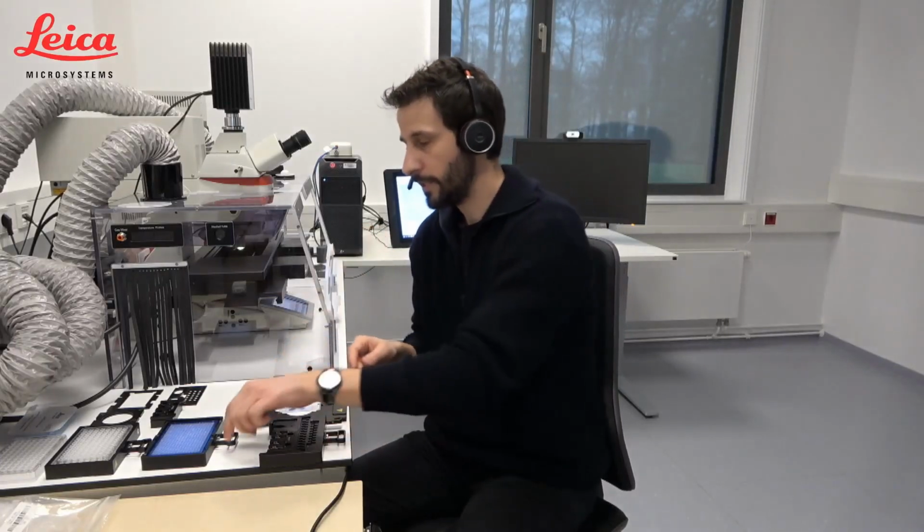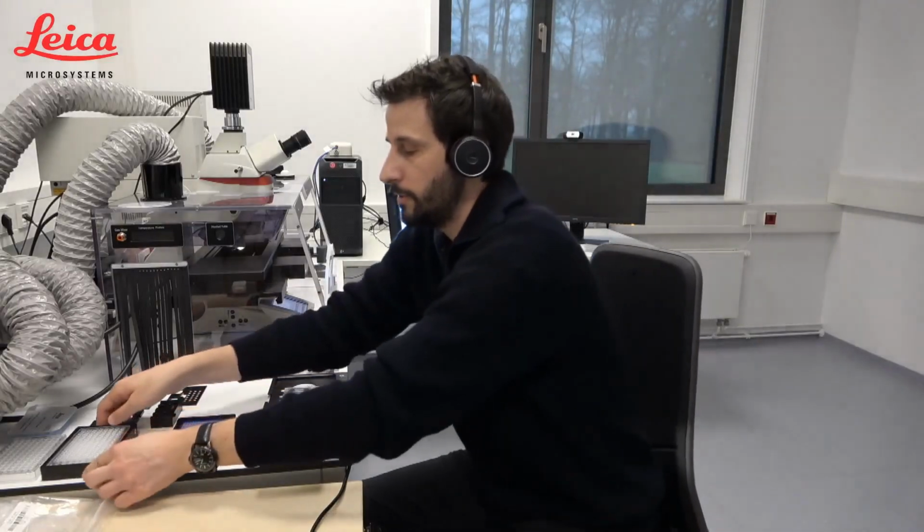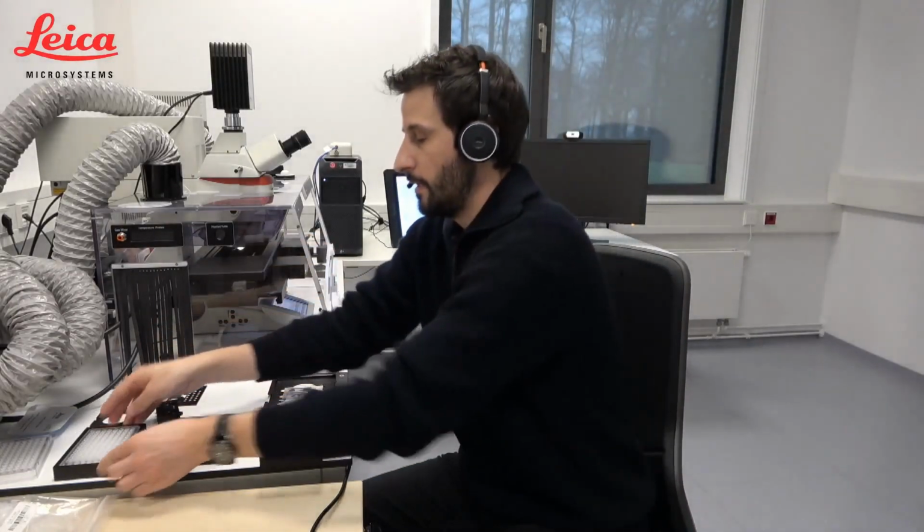You can also not only collect into these PCR tubes, you can also collect, and this is very interesting for a lot of you, into PCR wells. In this case, 384 well plates. What is more often used is 96 well plates. So this is also possible. Moreover, and we don't touch this today, you can also collect into special devices for living cells, which are these Petri dish devices. Yeah, so far so good.